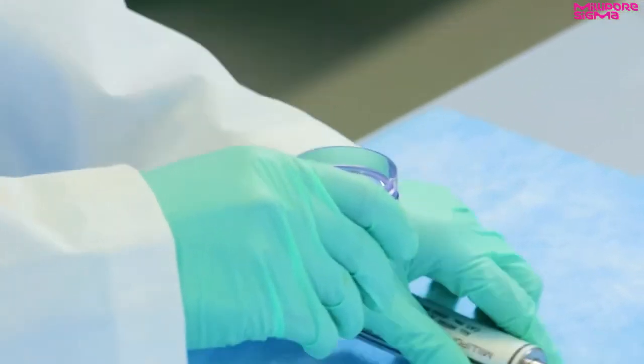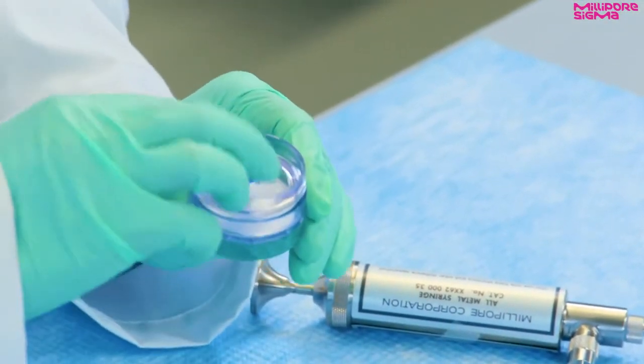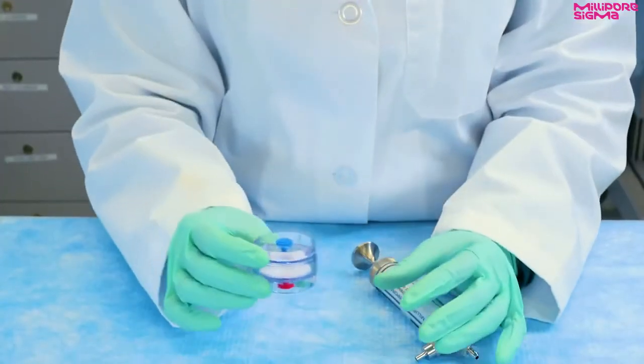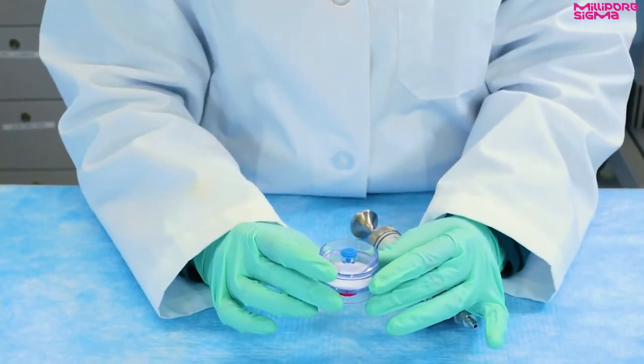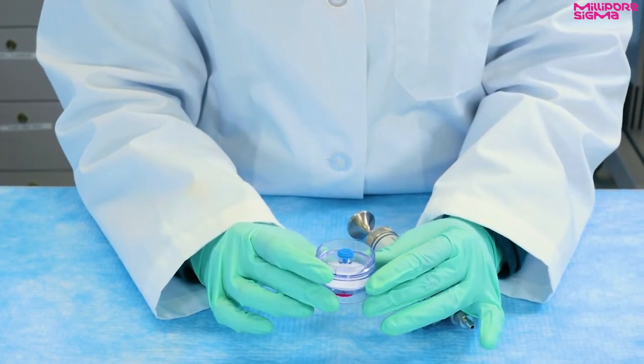Remove the monitor from the syringe and replace the protective plugs. The monitor is now ready for analysis. If the method requires colorimetric analysis, the color standards book is available for purchase.